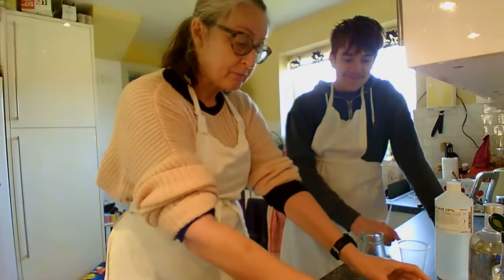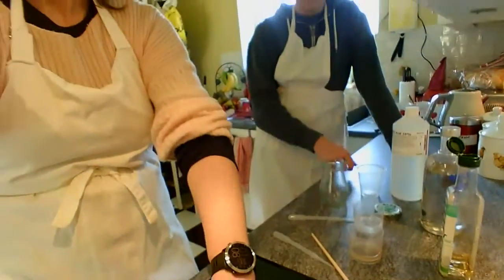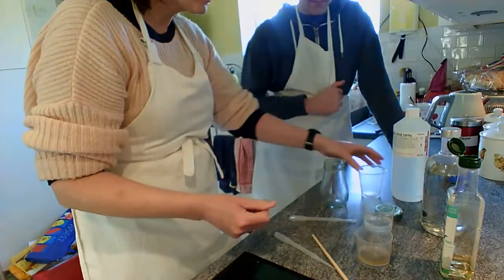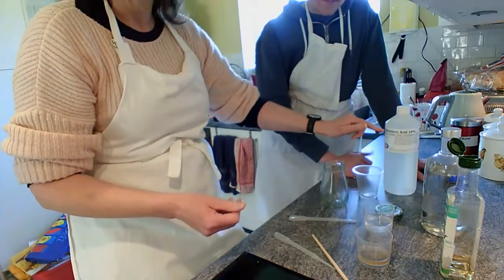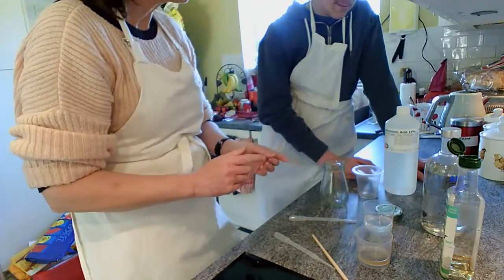These little beakers that we've got down here, which I'll just angle the camera down a little bit so you can see, we've also bought from the supermarket, containing food products. And this one here is the only thing that we can't get from the local supermarket, which is hydrochloric acid. Why do we need the hydrochloric acid? As a catalyst. As a catalyst, right.